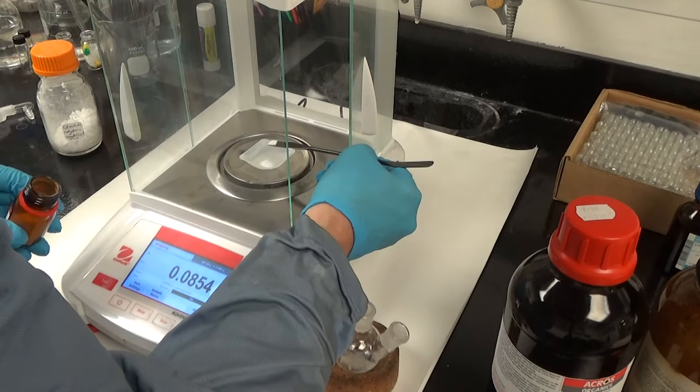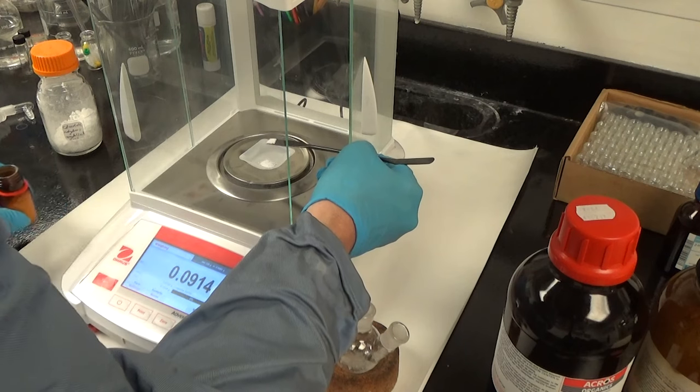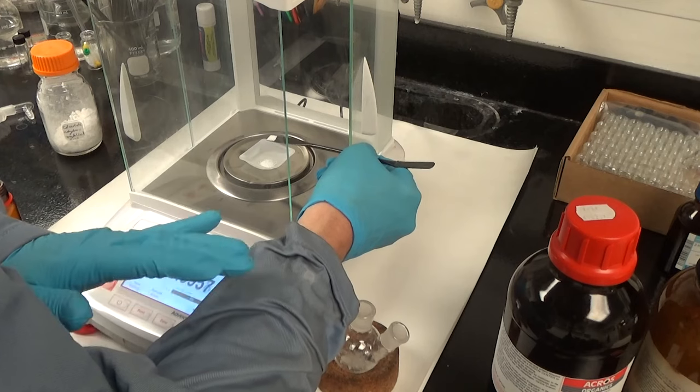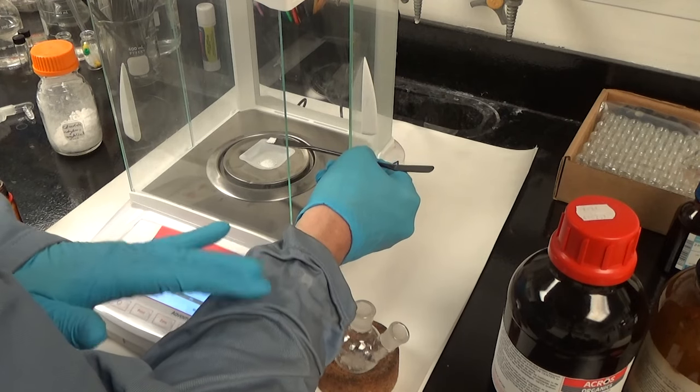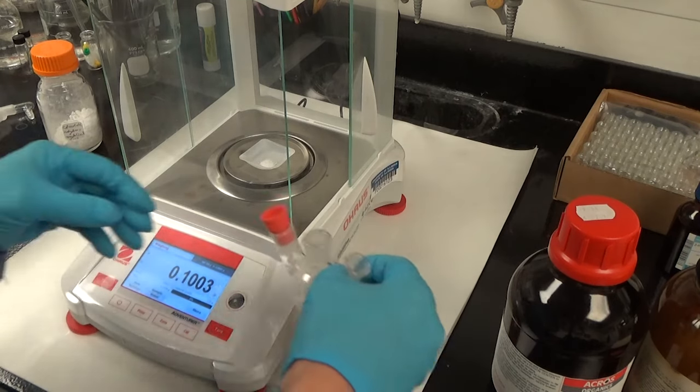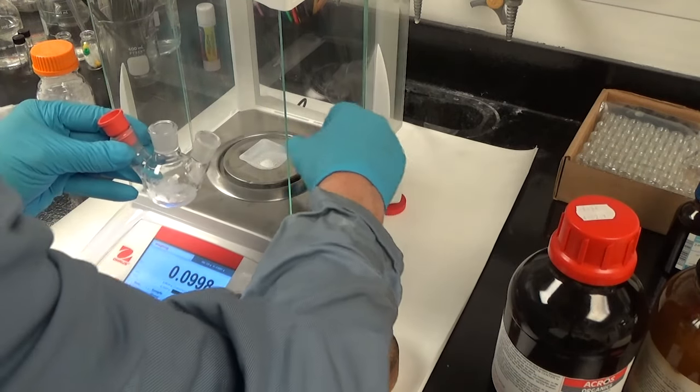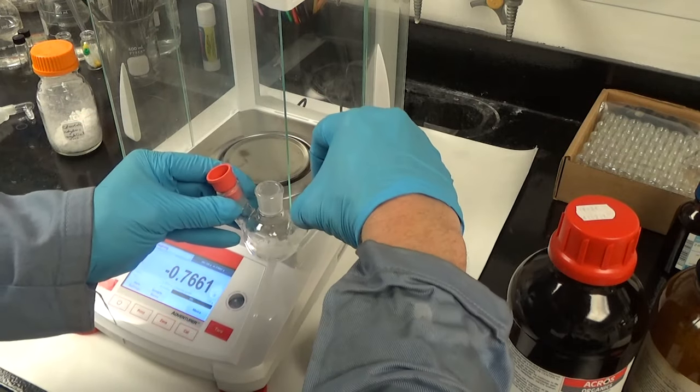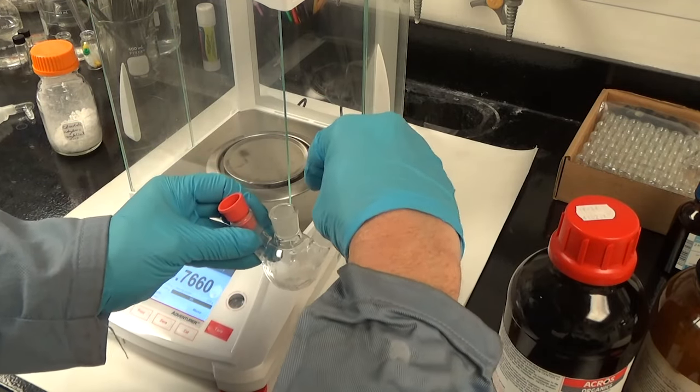So what we do is we use acetates and we displace the acetic acid with oleic acid at moderate temperatures. It doesn't work perfectly so we have to ramp the temperature up to about 200 degrees for about half an hour, cool it back down and degas it. Regardless, we've weighed out our chemicals and now we're loading up the three neck.